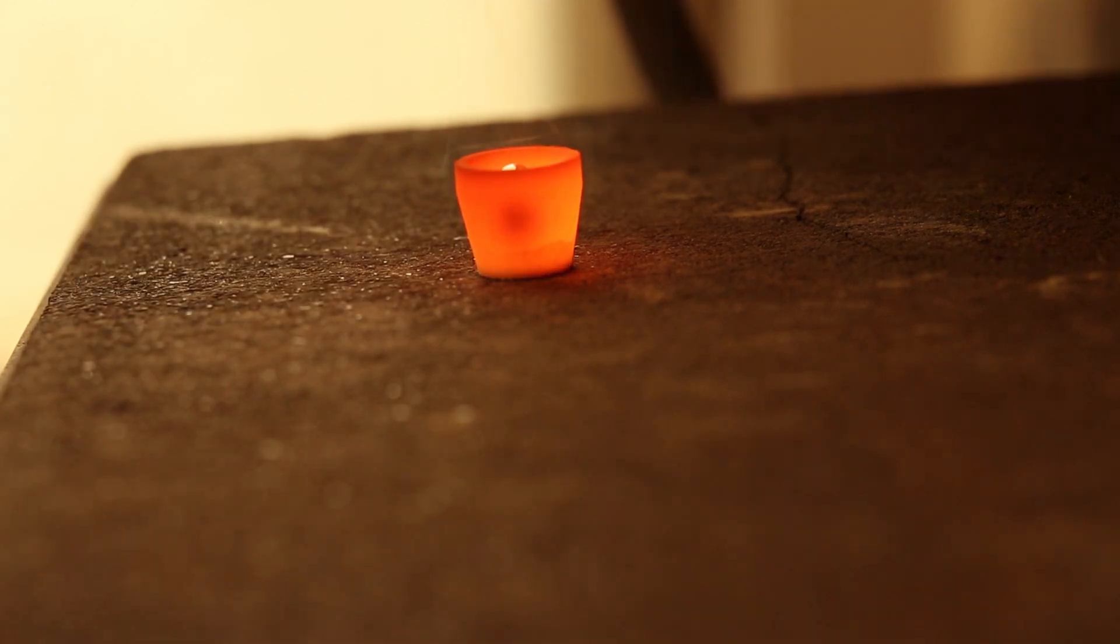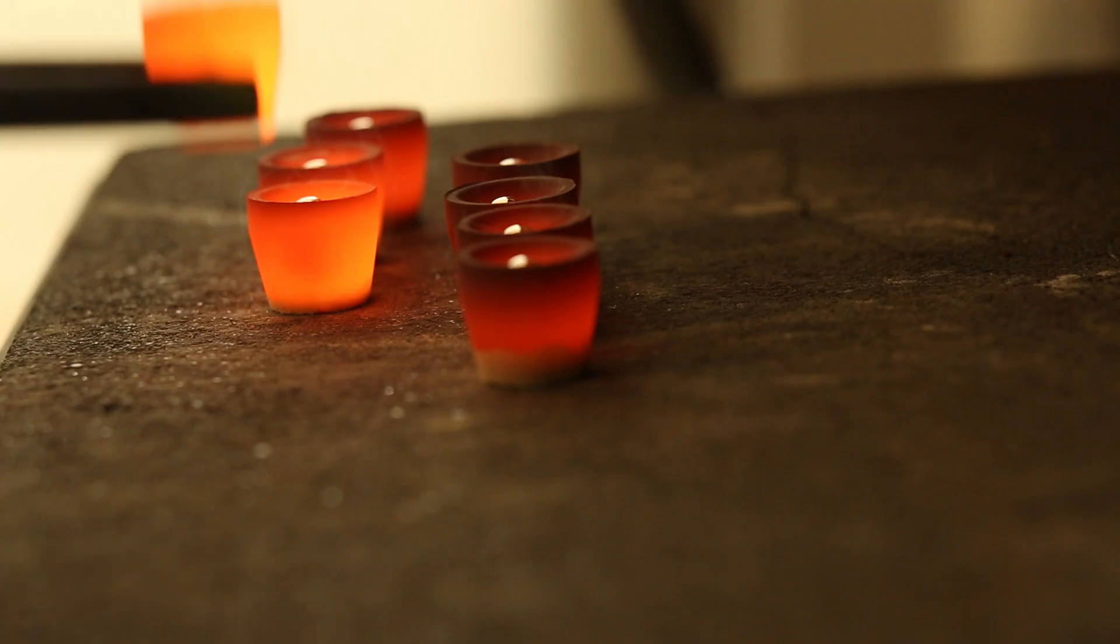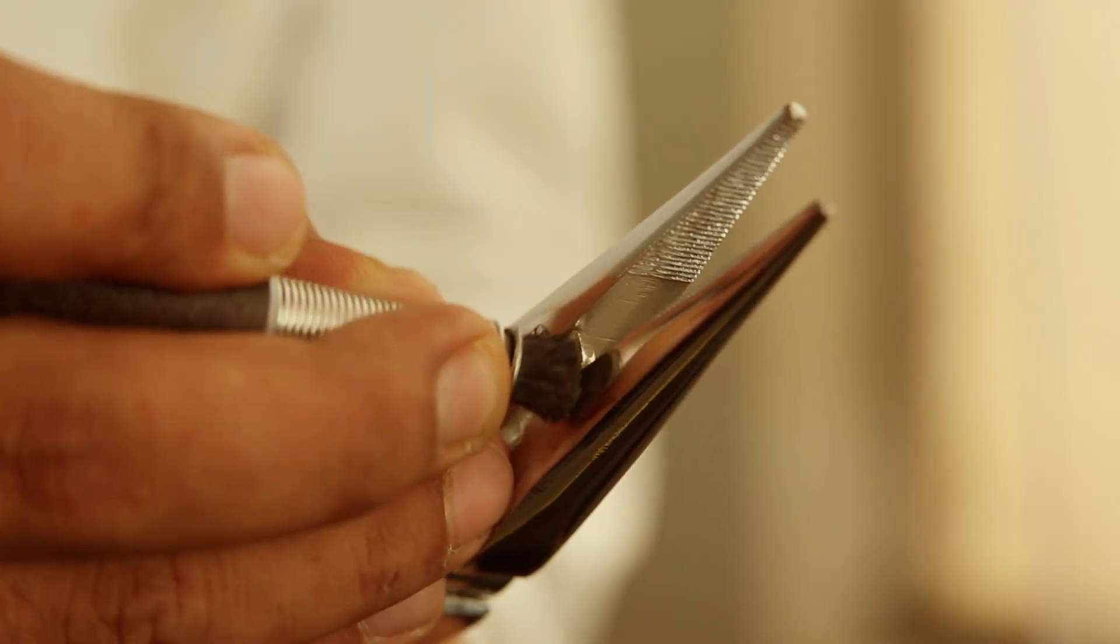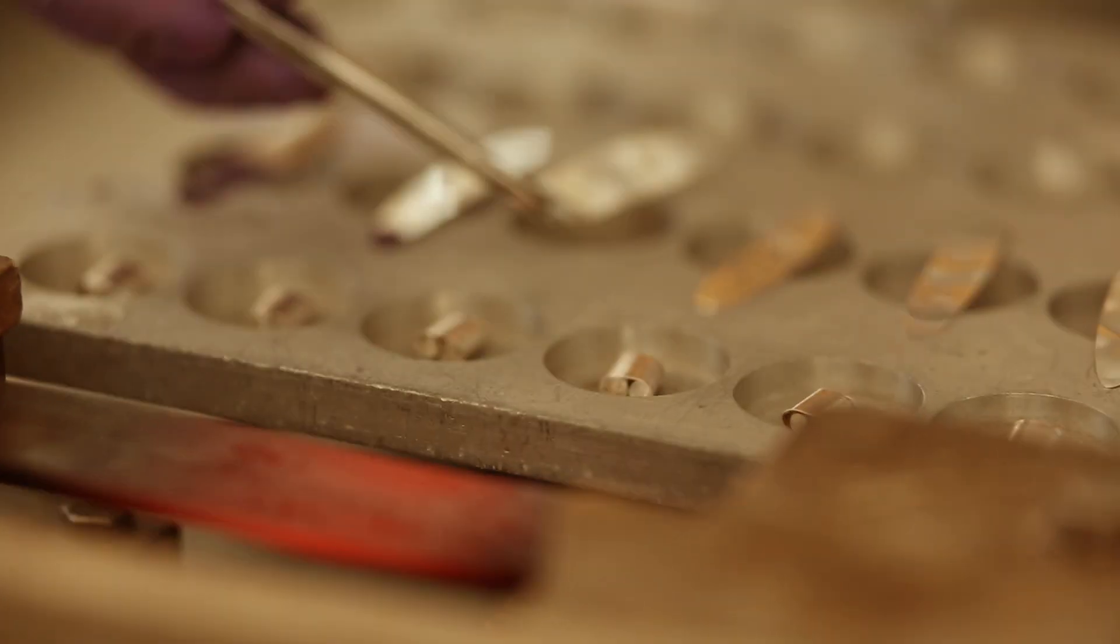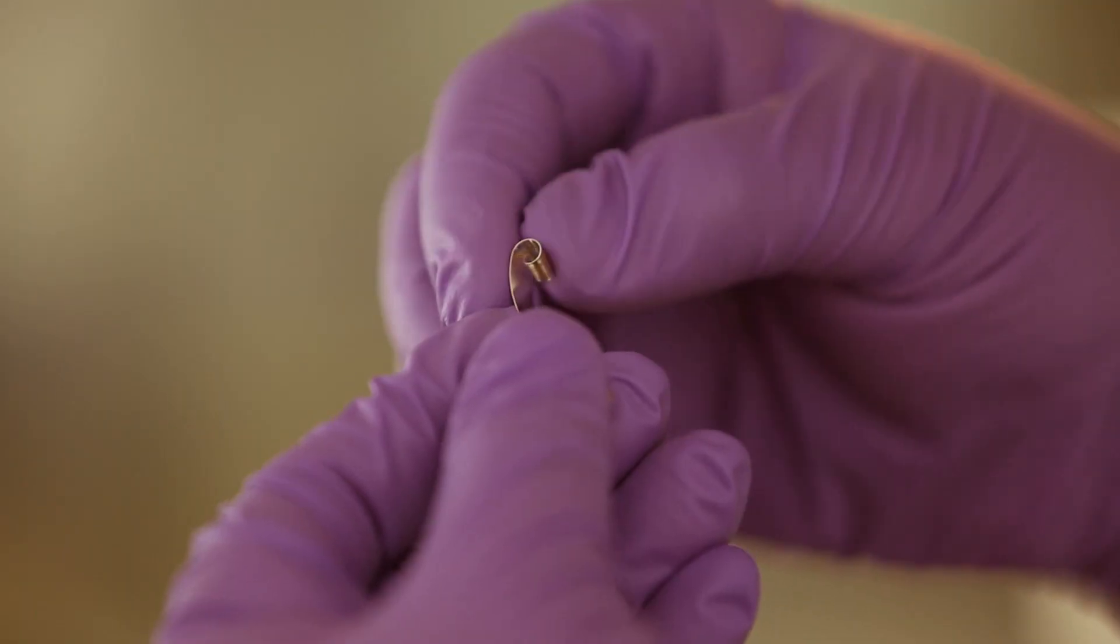The samples are allowed to cool, after which the precious metal beads are separated and manually cleaned. The beads are annealed and then hammered or pressed depending on what is required and then rolled into cornets.